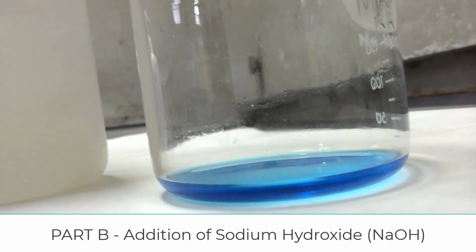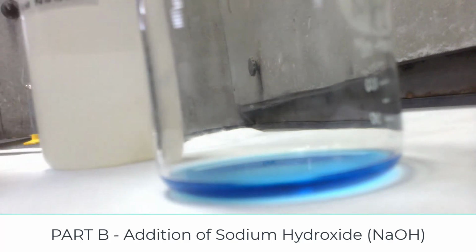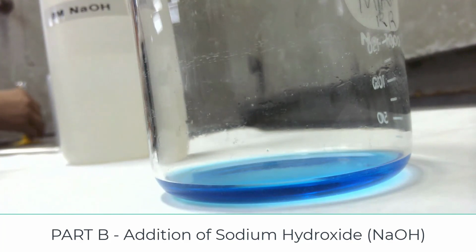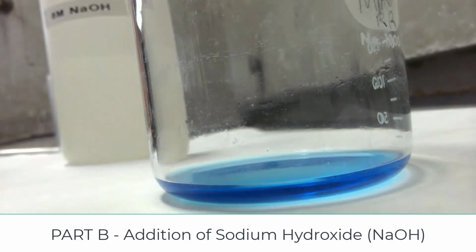Now I'm going to add some 8 molar sodium hydroxide. I'm going to add about 10 mils. I pre-measured that, so I'm going to add that to my flask.